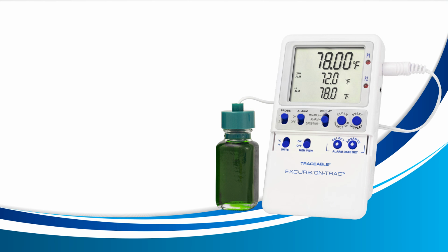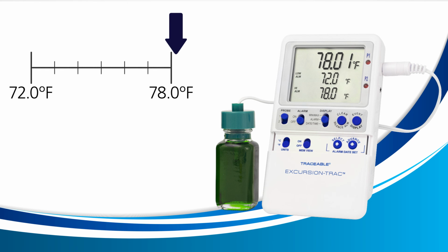The second way to handle an alarm event is to use the alarm switch on the left. Sliding the switch down to off will disable the current alarm. But it will also disable future alarms as well. If the current temperature returns in between your low alarm and high alarm range, and then leaves this range again, your device will not ring as the alarm is completely off.